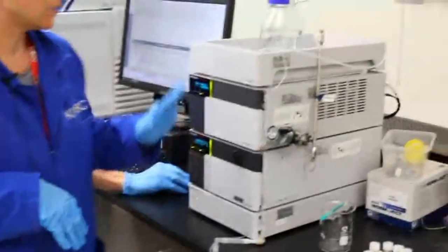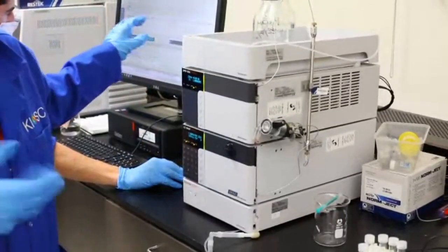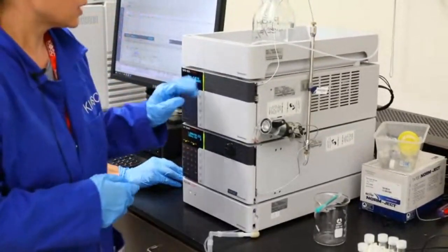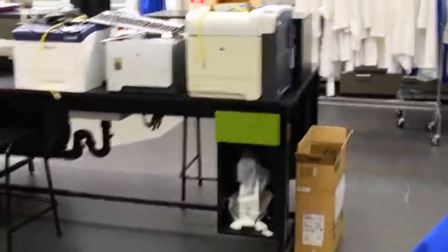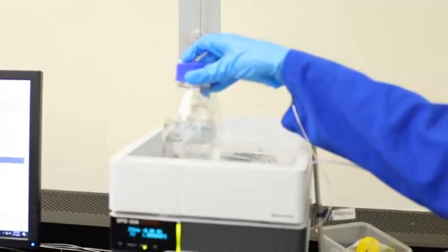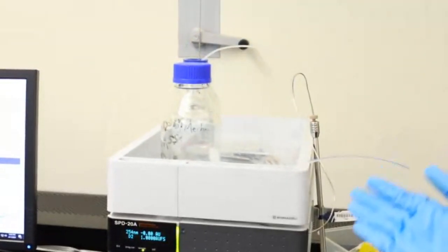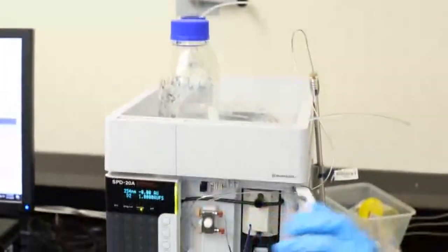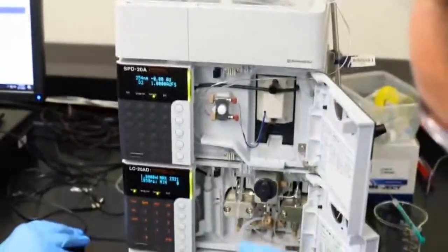Okay. Awesome. So here we have our HPLC. And over here is our computer where all our detected information goes to. So I'm going to get you to come around so you can show the machine. So excuse me guys, just one moment. Okay, so up the top here we have our methanol. So we've got an empty container and our full one. So the methanol makes our mobile phase. That then travels through here and then down to the bottom where we have our degasser.